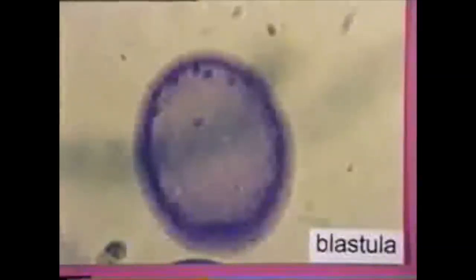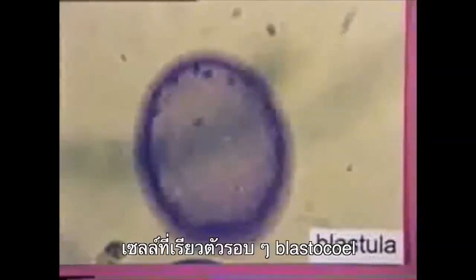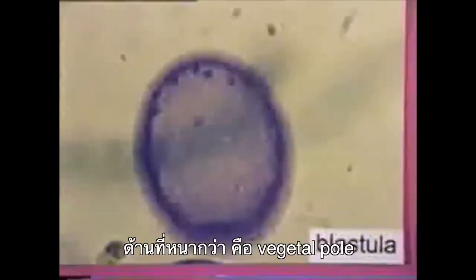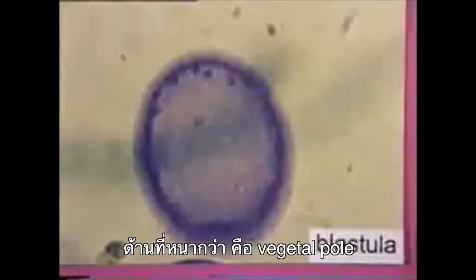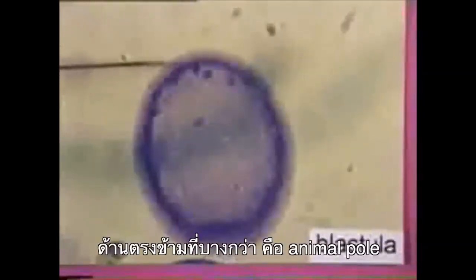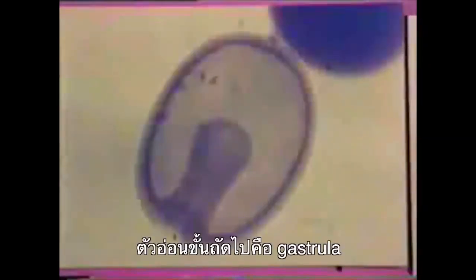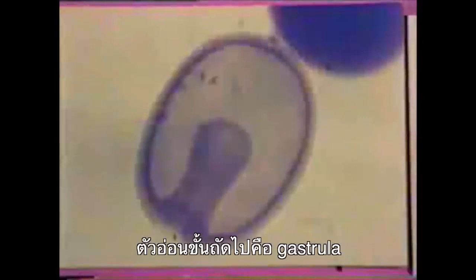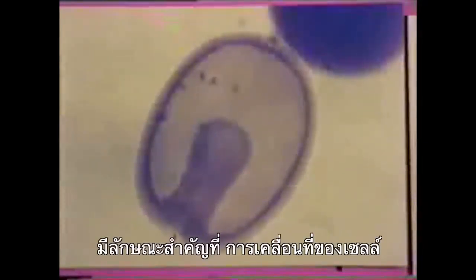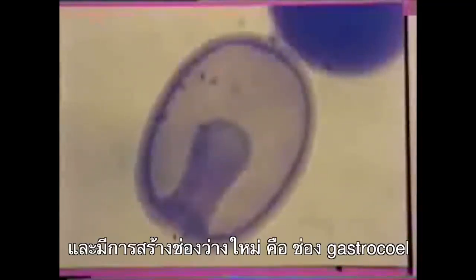Here we see a late blastula embryo. The cell layer that surrounds the blastocoele is not of uniform thickness. The thicker side is the vegetal pole. The thinner opposite side is the animal pole. The next stage is called a gastrula. Gastrulation is characterized by cell movement and the formation of a new cavity called the gastrocoele.